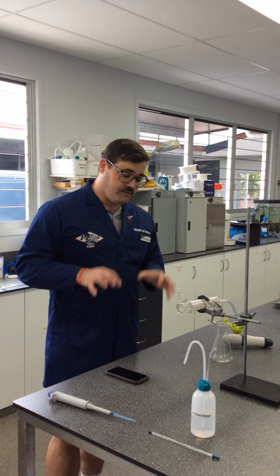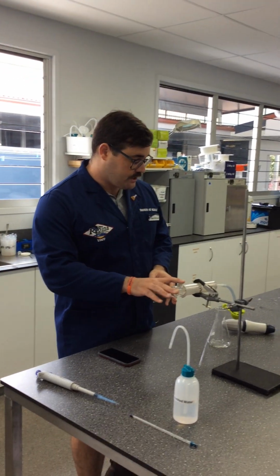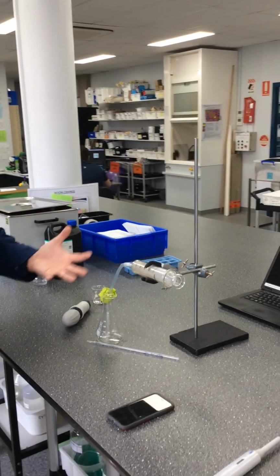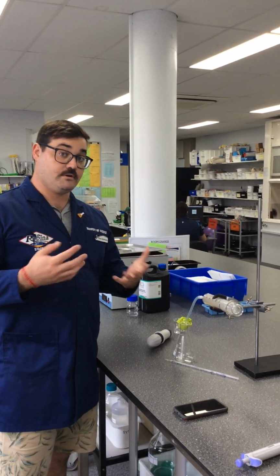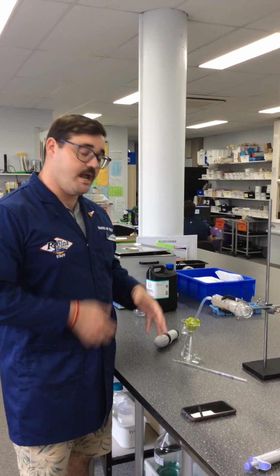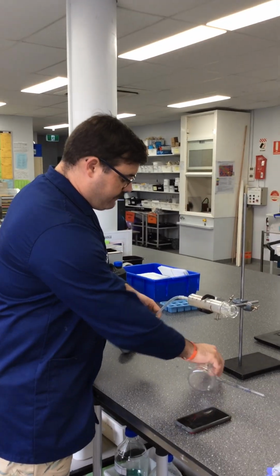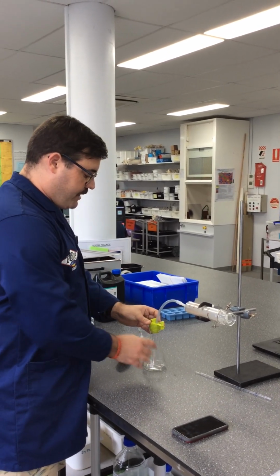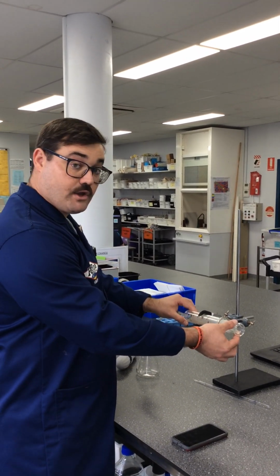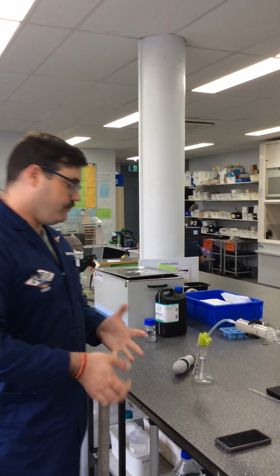All right, so we've got our gear here today, and if you have a look at the sheet, you'll see what gear we need. We've first got the gas syringe, so maybe if you come around, we'll have a look at our equipment. So we've got our gas syringe. Now, gas syringes, funnily enough, are a syringe that are used for collecting gas. In our experiment, the products of the chemical reaction are gases. So what's going to happen is we're going to have our 250 ml conical flask with a bung in the top here. Okay, so the bung has got a hose attached to the flask, and as it produces gas, it's effectively going to push this out, and that's going to give us a measure of how much gas is being produced.